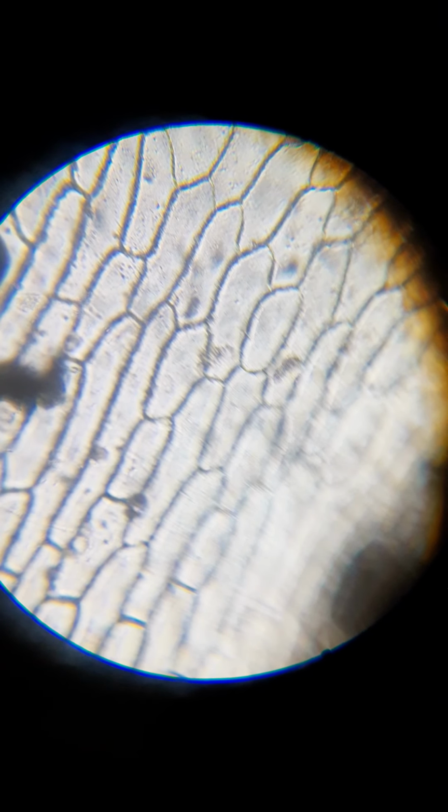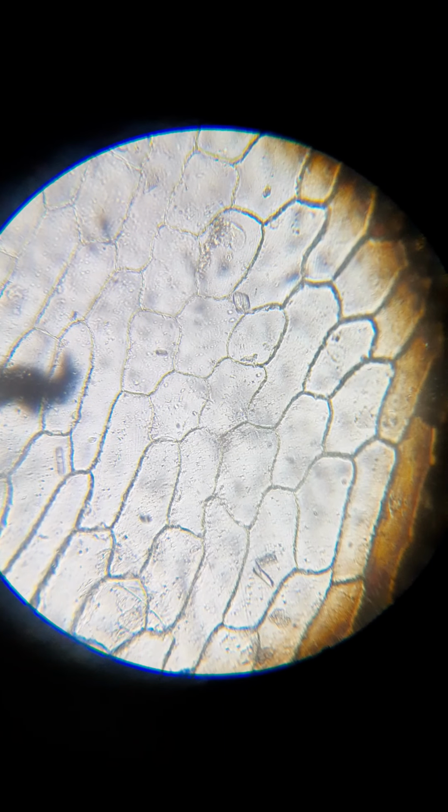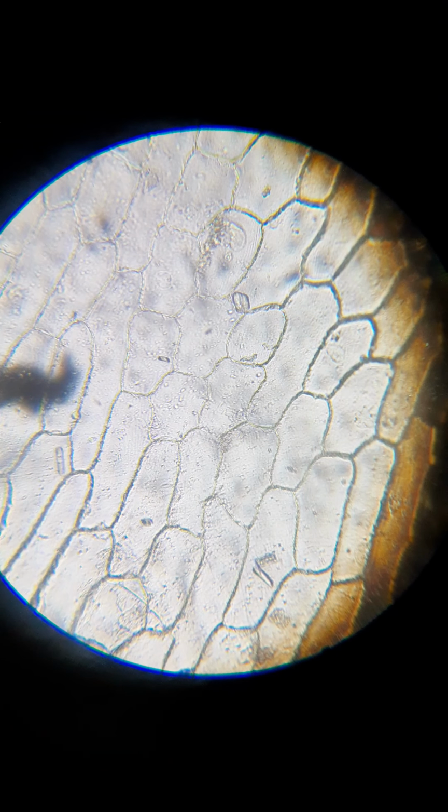So this is why I wanted to do this part first, because I don't know if I can get a good image of this occurring. Let me move this around here. See if I can see some action. Oh, there we go. I think that might be good there. You see how thin it is right there in that area?